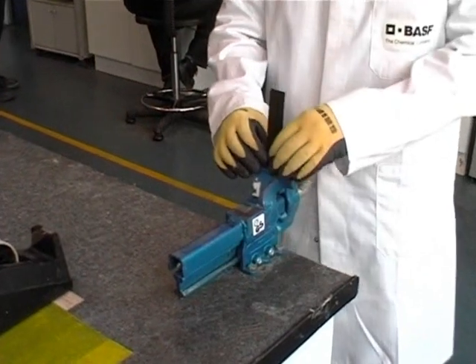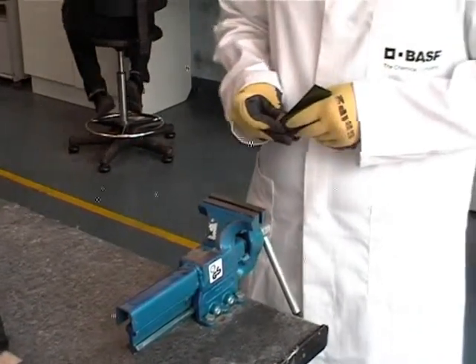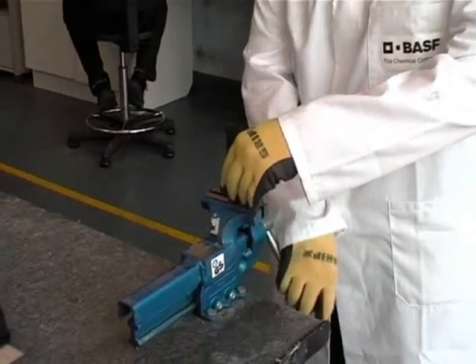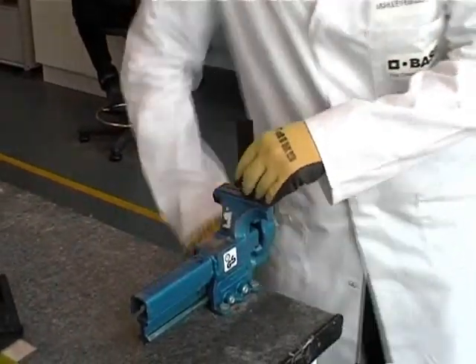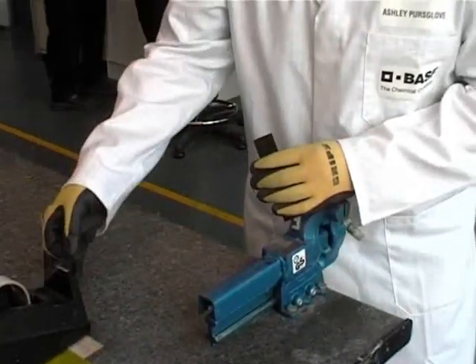A strip of pre-painted metal is folded over on itself. Usually a rough fold is done first, and then this is tightened to make a 180-degree fold. The vise or press is used to ensure that a tight radius bend is formed.